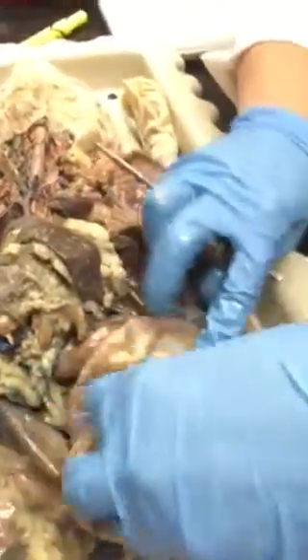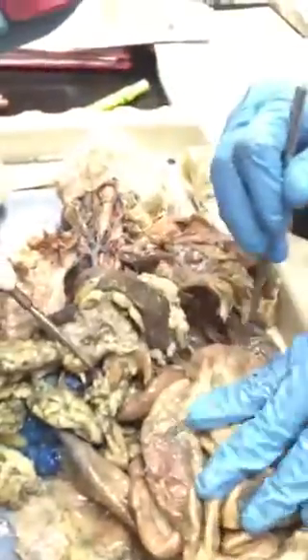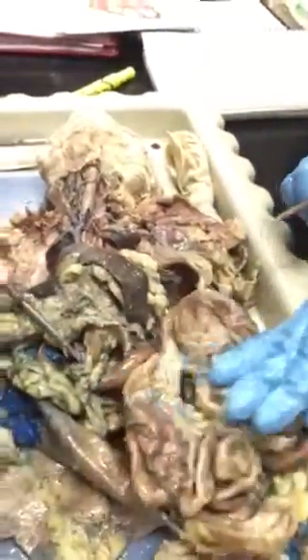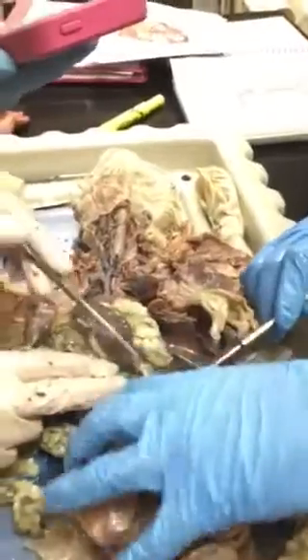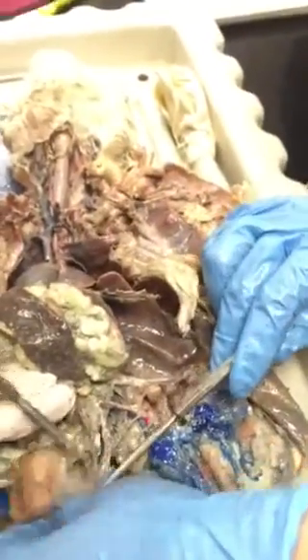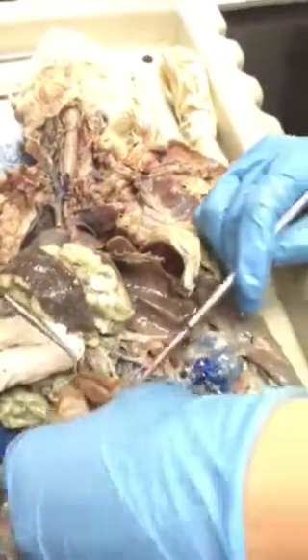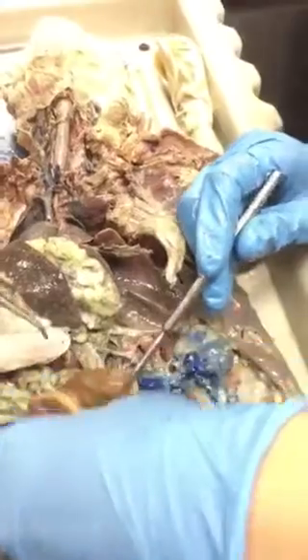But one thing you're gonna learn, guys, is that the large intestine actually comes up and over and then back down, and then there's all these small intestines in between. But for now, if you can at least know that this is a superior mesenteric artery, and it does appear to be going to this small intestinal area. Where's the inferior one? We don't have to know inferior. Sweet.